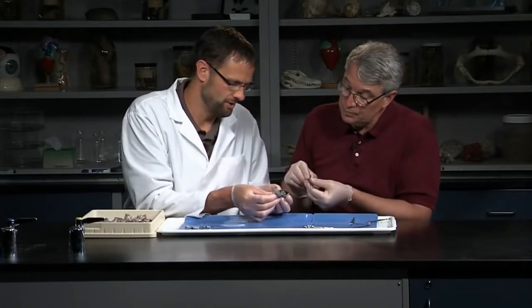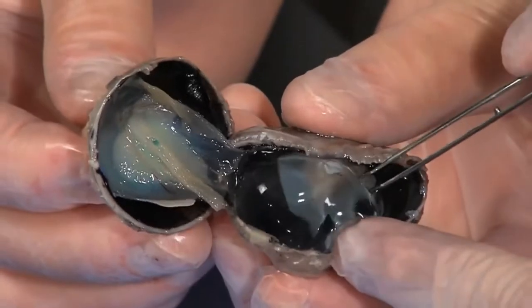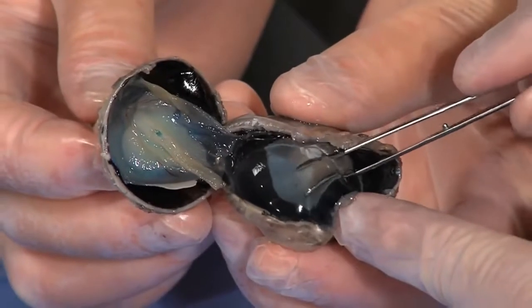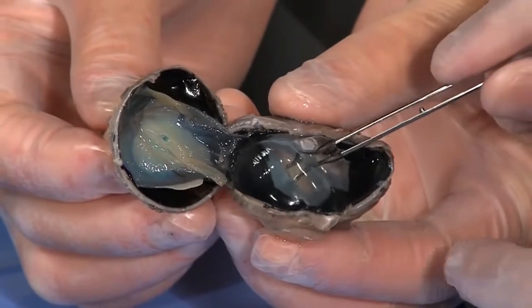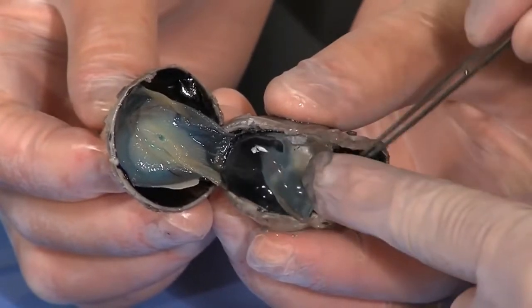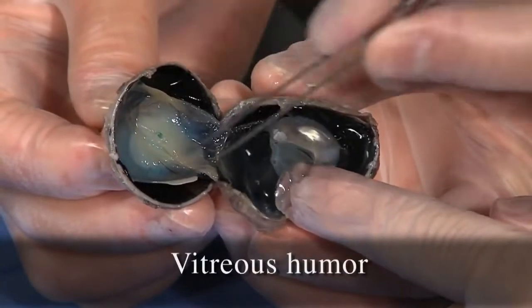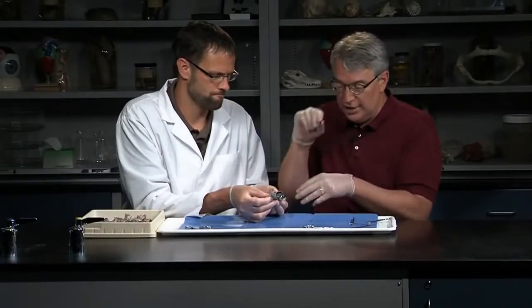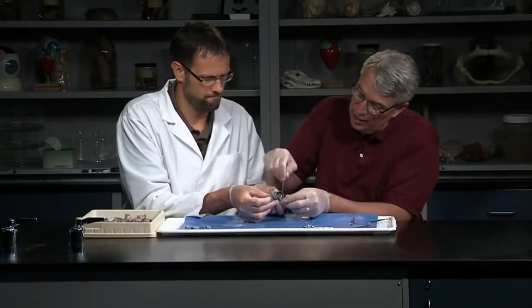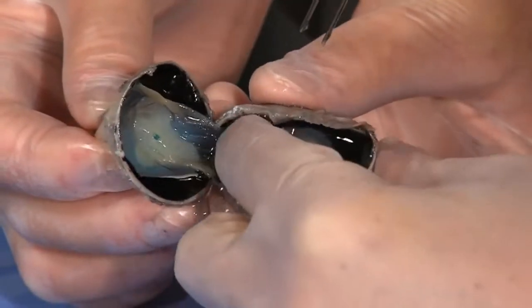Should we go ahead and pull it here? Students will notice immediately that the eye is full of this big clear jelly-like substance. This is called the vitreous humor. It fills the inner part of the eyeball and mainly helps the eyeball keep its shape — light passes right through it. You probably want to just pull that out of there.